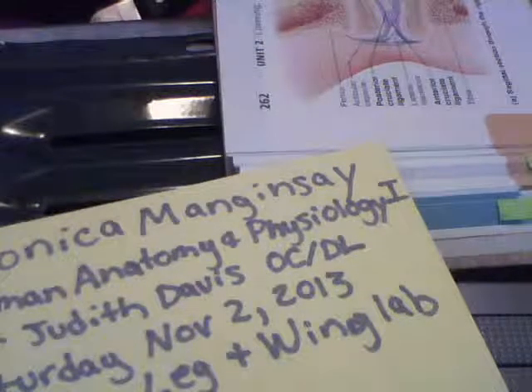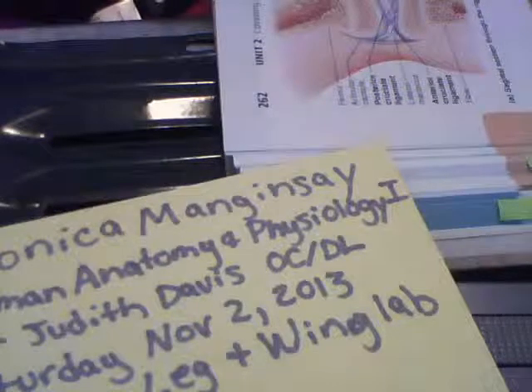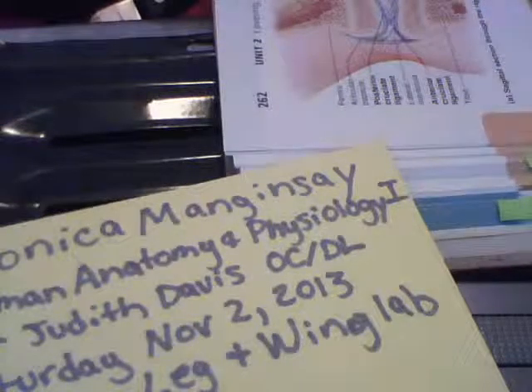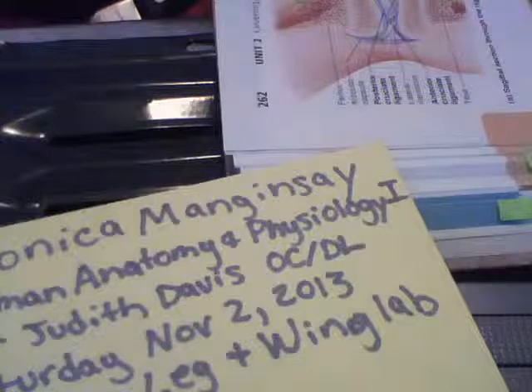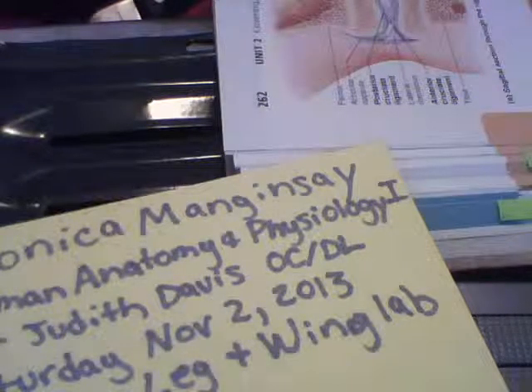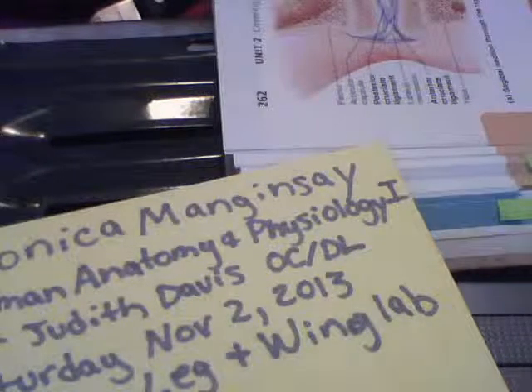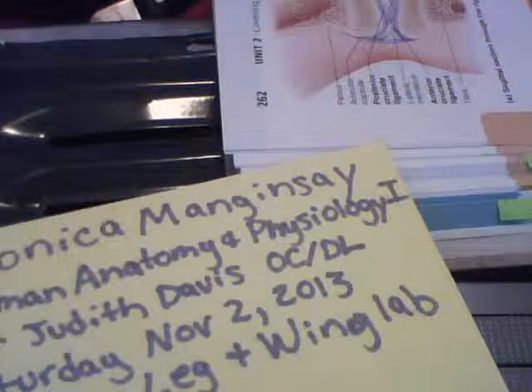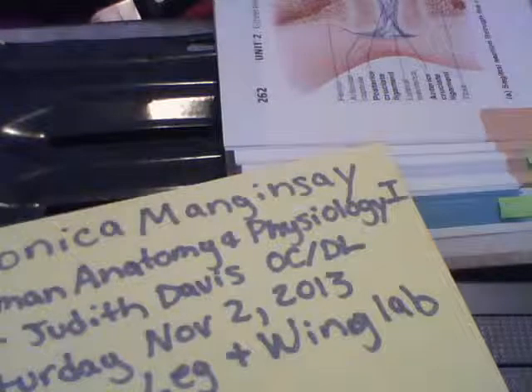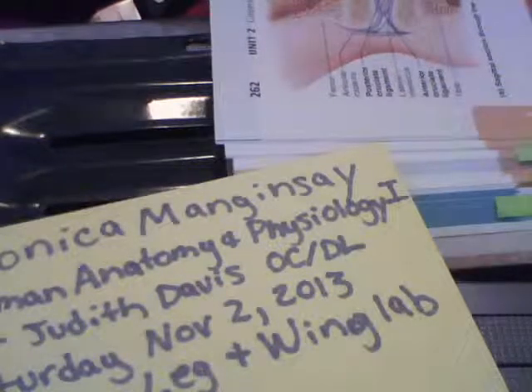Although these ligaments are in the joint capsule, they are outside the synovial cavity, and synovial membrane nearly covers their surfaces. Note that the two cruciate ligaments, both running superiorly to the femur, are named for their tibial attachment sites. The anterior cruciate ligament attaches to the anterior intercondylar area of the tibia.